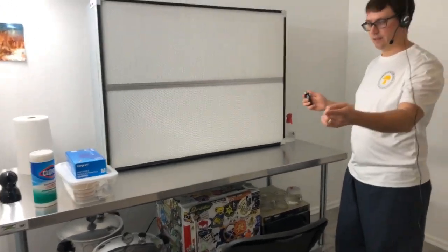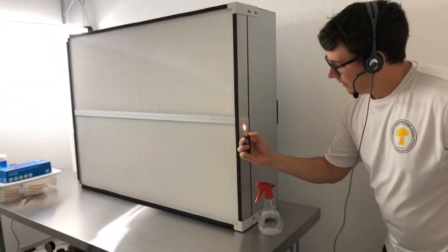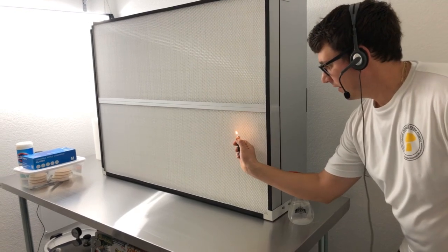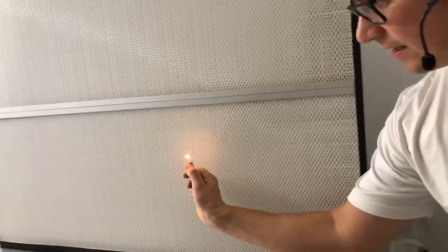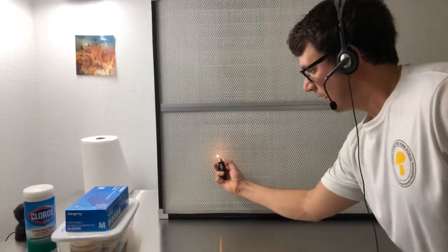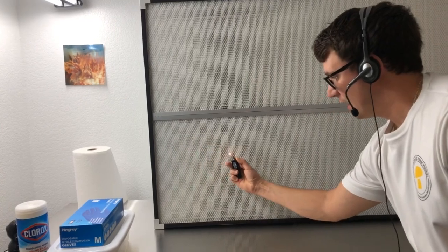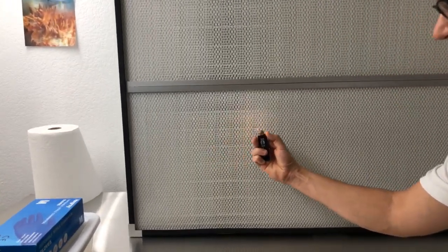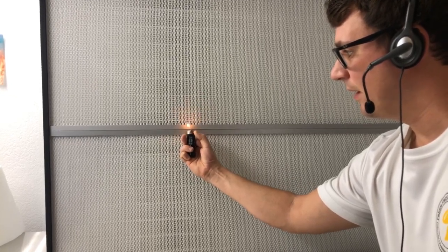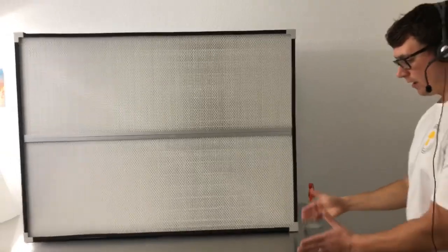If you come here and look at the flame from this side, you can see that it's nice and straight, but as soon as I cross into the flow it starts to go sideways. You can tell it has a nice even air current all the way across. If there is any turbulence, the flame would probably blow out or stand up straight. As I come up into this dead zone you can see the flame stand up a little more, but it's still blowing, so I'm pretty confident that the laminar flow from this hood is going to cover the entire workspace.